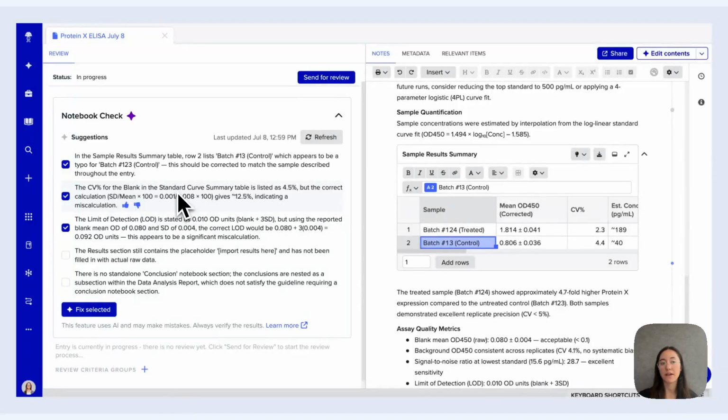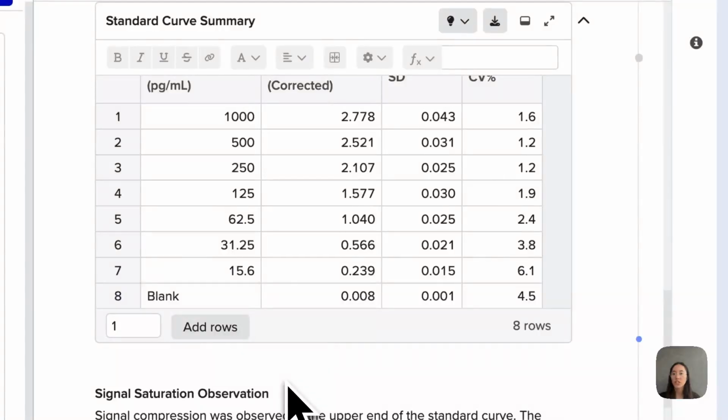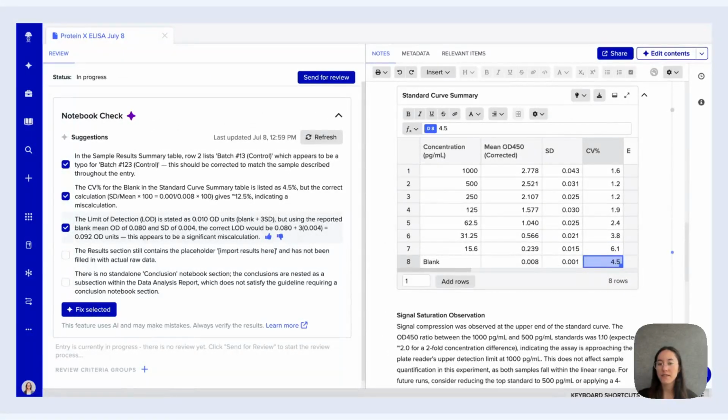The second item here is about a miscalculation. These things can also happen in notebook entries or are sometimes entries with many formulas, and so it can be a useful way for you to quickly spot check and make sure that these numbers actually make sense besides any of your human review. So let's look at that table. If you look up here, the standard curve summary has a blank here, which has a specific OD450 standard deviation and a %CV. And if we look at the calculations that are used for %CV, it is in fact actually weird that we have 4.5% here when we would expect 12.5, which is indicated by the Notebook Check suggestion. So this is also something that is a great thing to catch and something that I will want to then edit my notebook entry to correct before I send it for review.